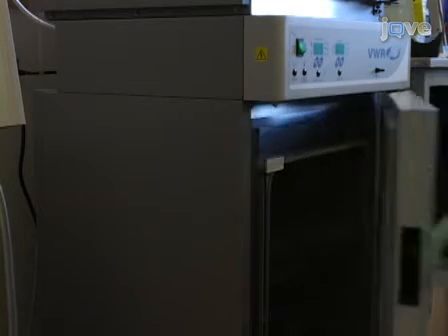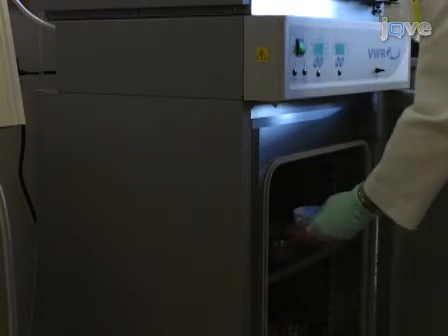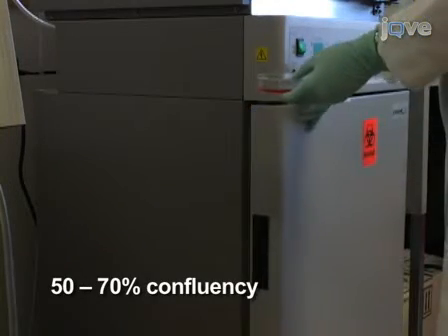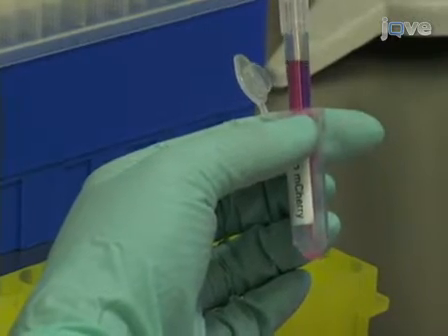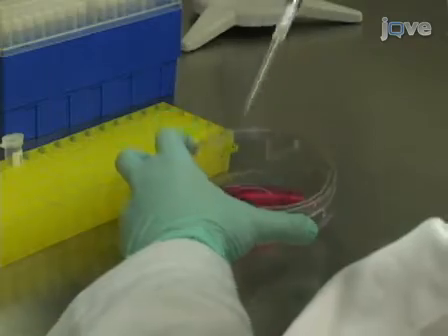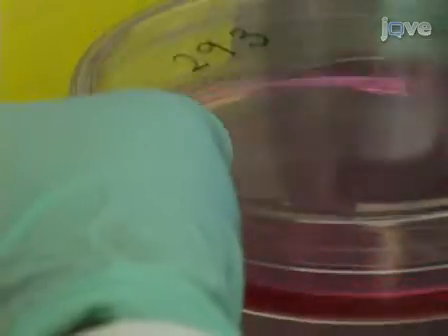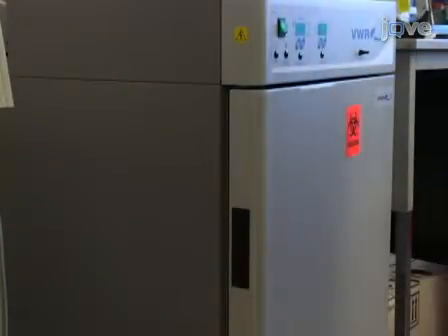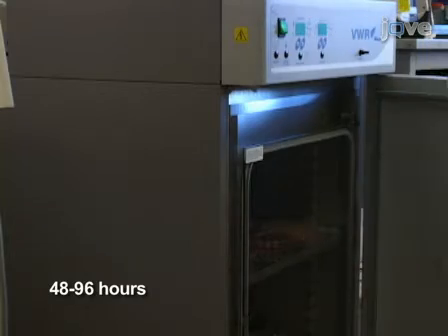Now it is time to transfect 293T cells with the DNA you have prepared. Use cells that you have plated 24 hours in advance and that have reached 50 to 70 percent confluency. In the tissue culture hood, pipette all of the prepared DNA onto the 293T plate. Mix gently by tilting the plate back and forth. Return the cells to the incubator and allow viral production to continue for 48 to 96 hours before harvest.